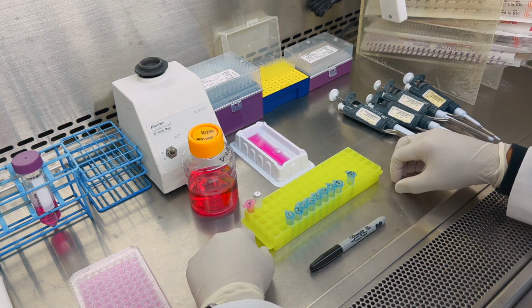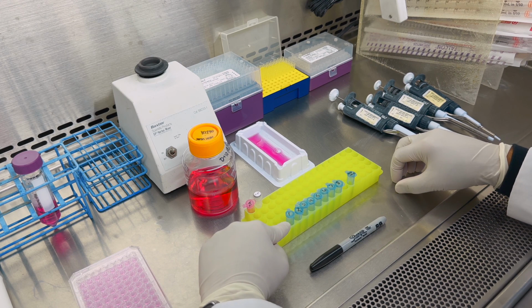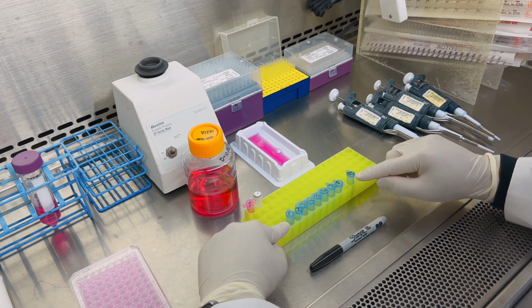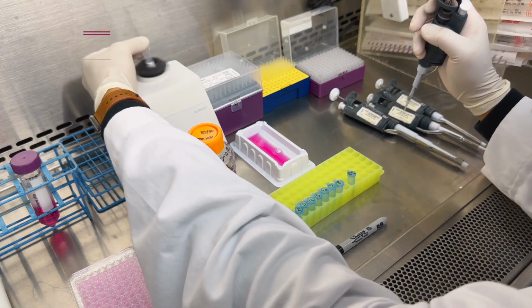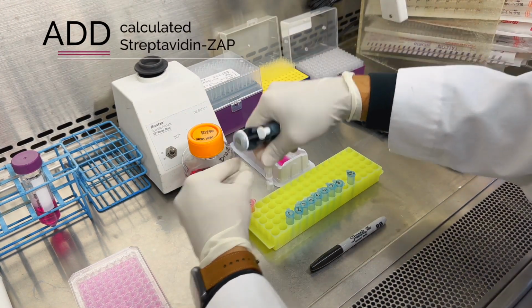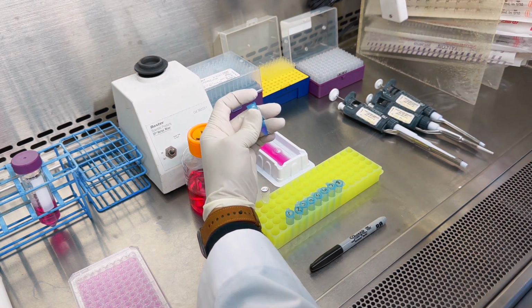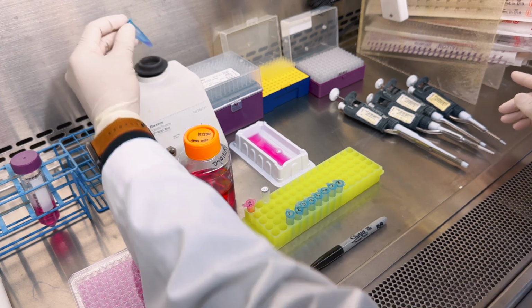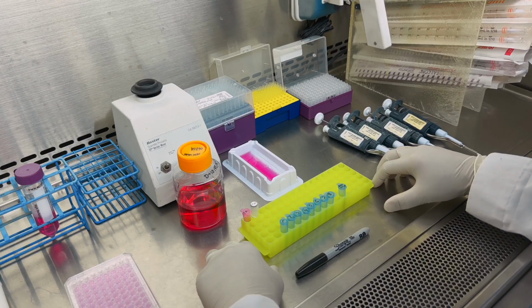Look again at the Excel workbook to get the amount of streptavidin-ZAP that was calculated and added to tube number 1. We will add that same volume into the ZAP only tube. In my case, it was 0.8 microliters. Pipette up and down a few times and vortex briefly. We will incubate that tube at room temperature for 15 to 20 minutes.